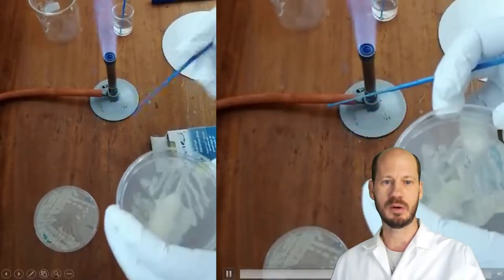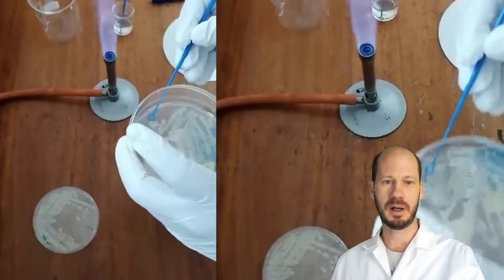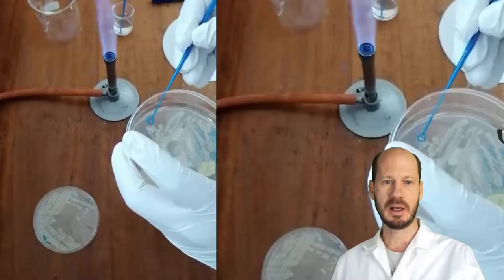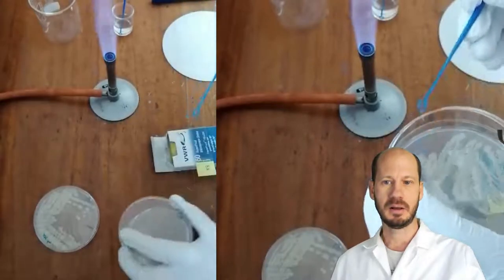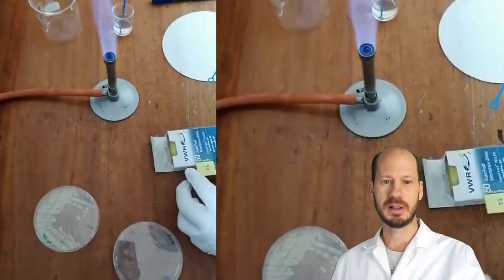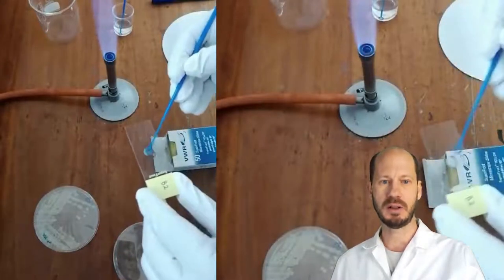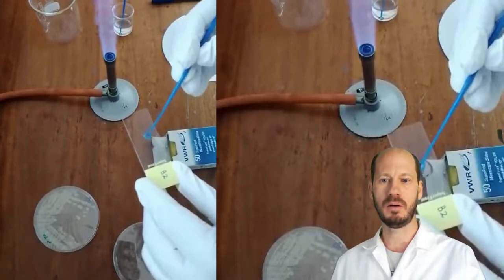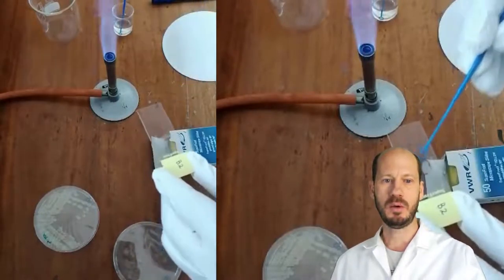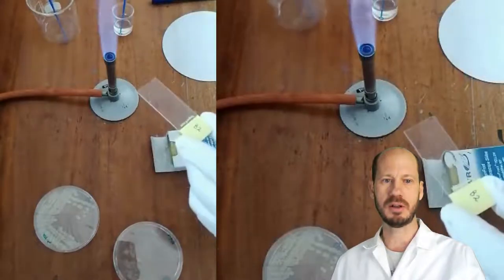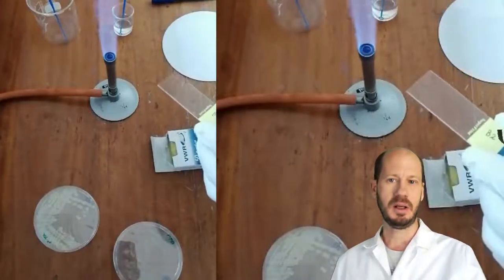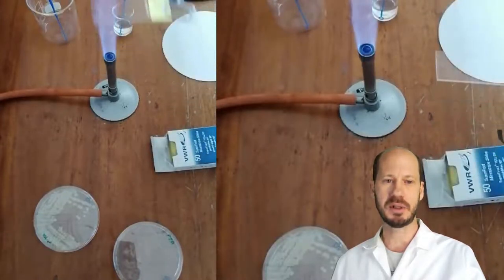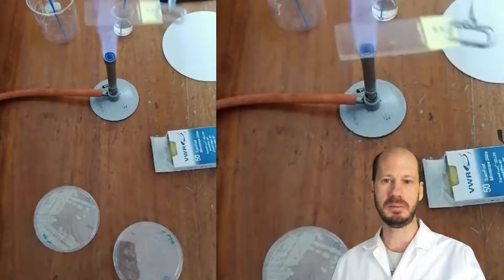She will remove now some of the cells from the agar plate and we will place it on the slide over the drop of water that you had before. Now, for this method, you want to have quite a lot of cells. Why do you want a lot of cells? It's because you lose quite some of them in the washing steps that you have in between the staining.